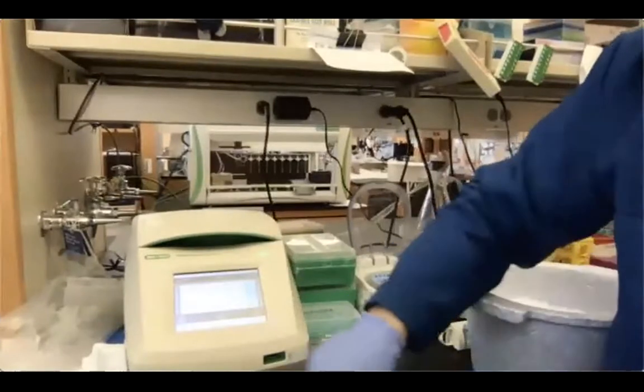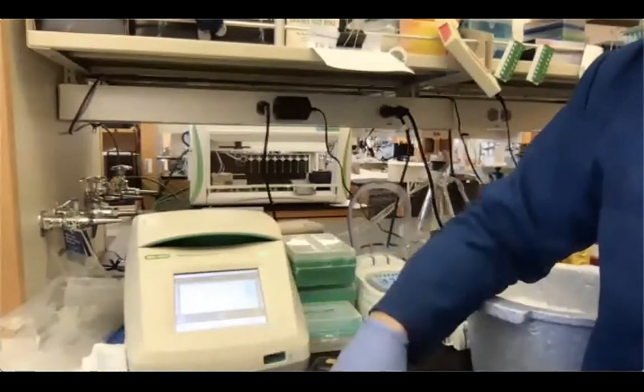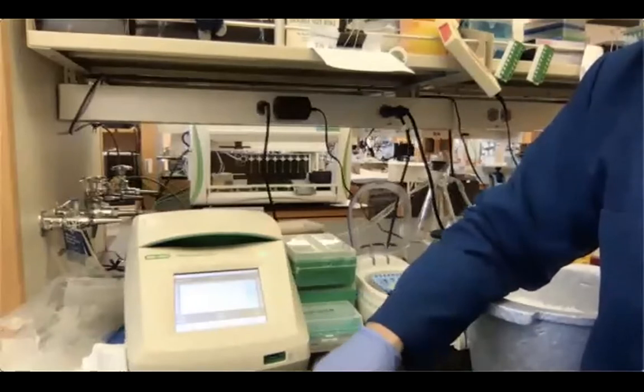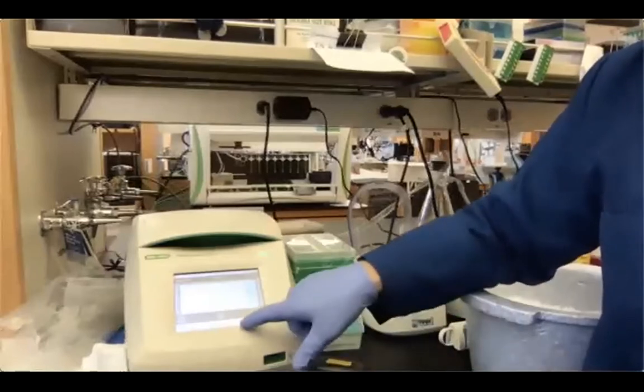Our PCR is almost concluded. Once our samples reach the temperature of about 20-25 degrees, I can take them out and perform the purification right away. Again, you can purify your samples both in PCR tubes or in 1.5 ml tubes. I'm going to try to show you again one more time in 1.5 ml tubes how the purification works. Hopefully you'll see it a little bit better. And then after purification, again, we're going to quantify the samples using the Qubit and also load the samples on the TapeStation.